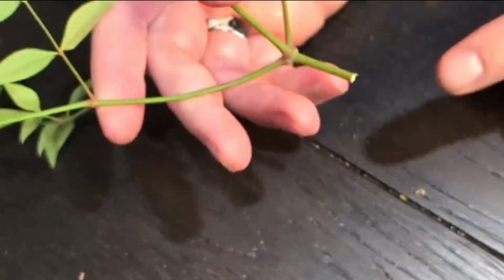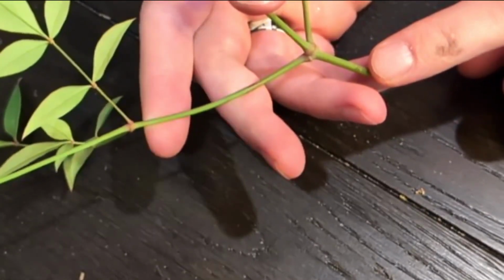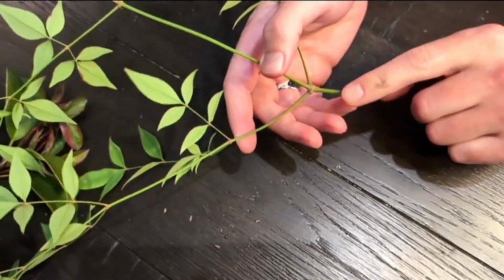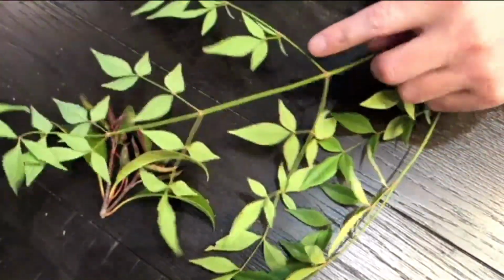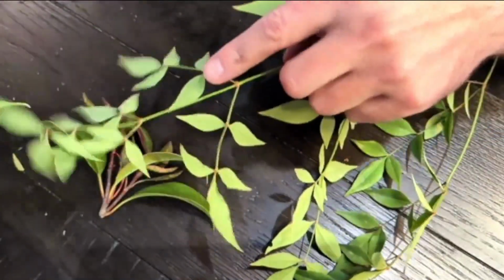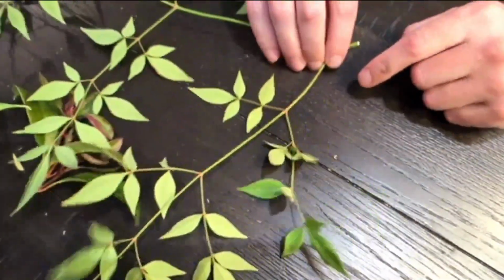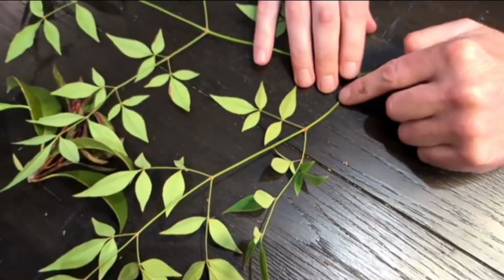We also have this one here. This is called heavenly bamboo, very common landscape plant. And here's the petiole. See if we can zoom out more here. I don't know if we can get it zoomed out enough. This leaf is huge. That's good enough. So here's the petiole. And if you notice, branching off once, twice, following the rachis down again and again and again and again. And if we follow one of these, right? So we follow this one here. We can do this one. Following this one leaflet, right?